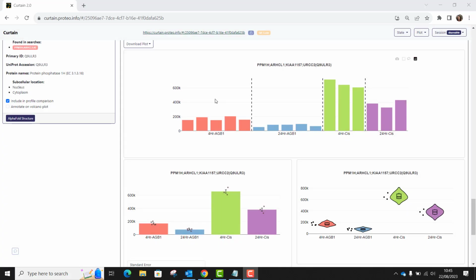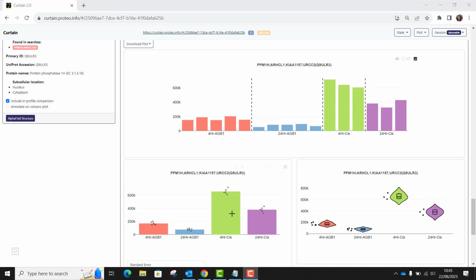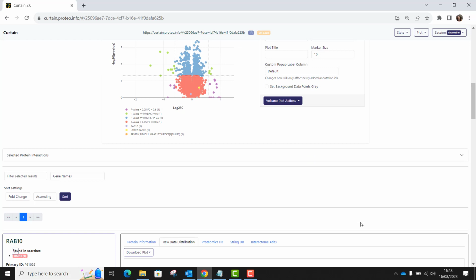You can evaluate the data for an individual protein using the plots that appear below the volcano plot when that protein is selected. For example, looking at the plots for ppm1H, you can see the intensities plotted here as a bar chart, a combined bar chart with scatter, and a violin plot. These are all different visualizations of the same data, but they help you appreciate the variation within and between conditions for individual proteins.